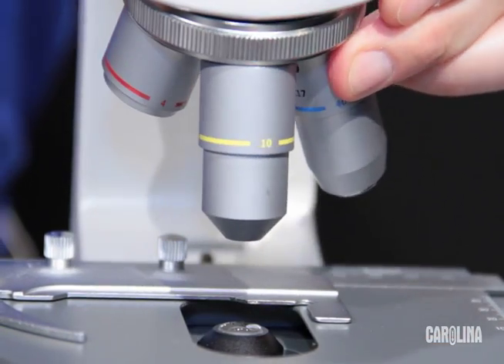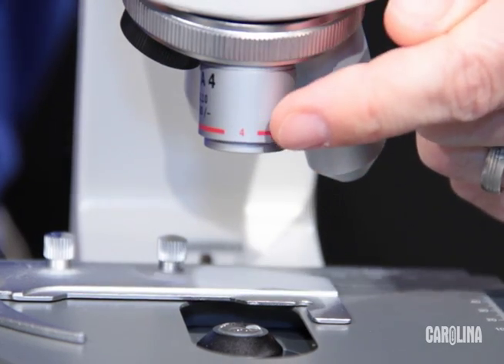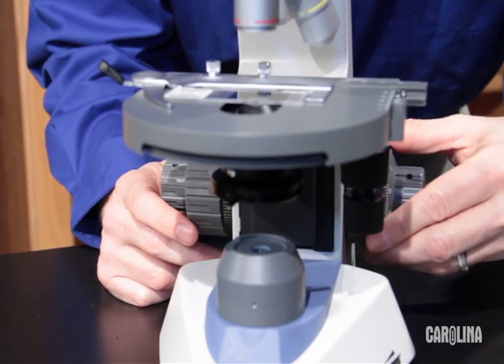Now rotate the lens turret to lowest objective power which is normally 4x. Then place your specimen on the stage so that the light will come through the area that you want to study.